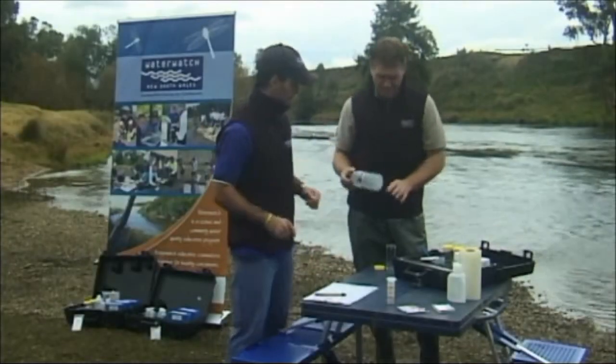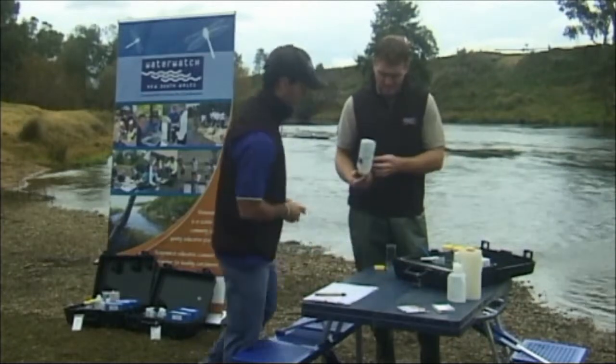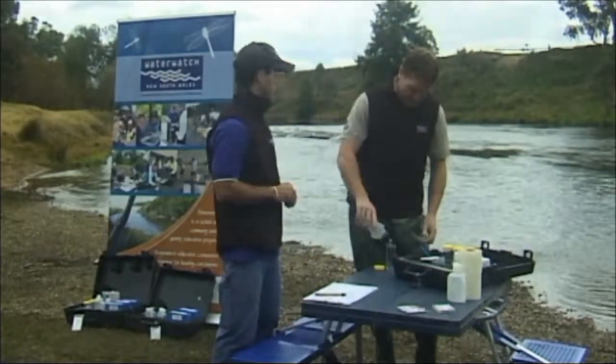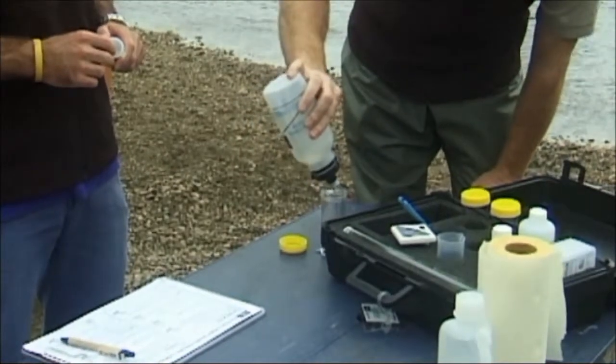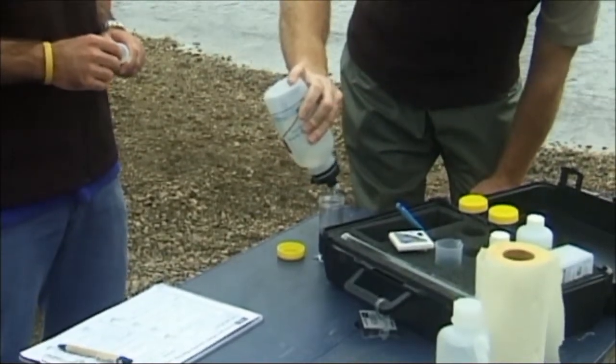Shake the sample. Rinse out a small container with the sample water at least twice. Fill the small container with sample water, or test directly from the sample bottle.